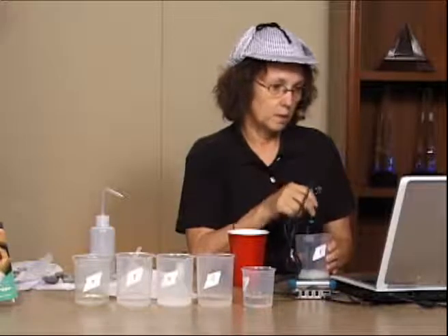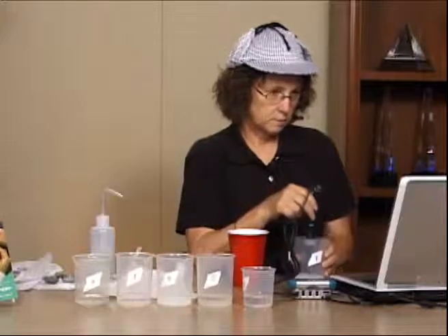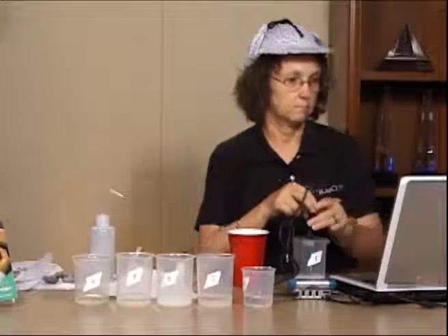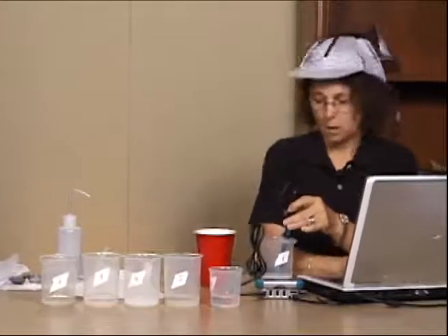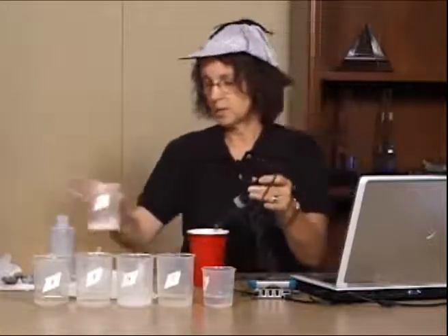And I'm getting a reading of about, I don't know, it's changing here. When that number becomes constant, and it's becoming constant here at about 5.97, take and rinse that off.